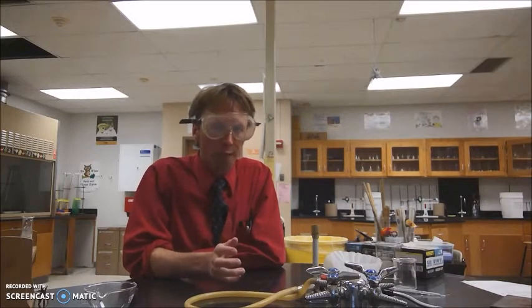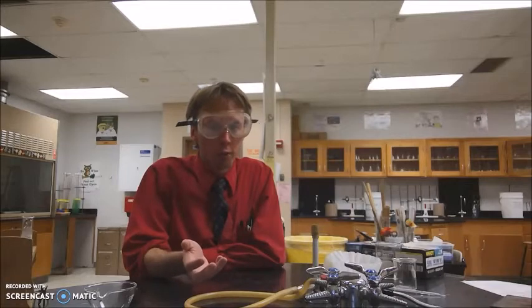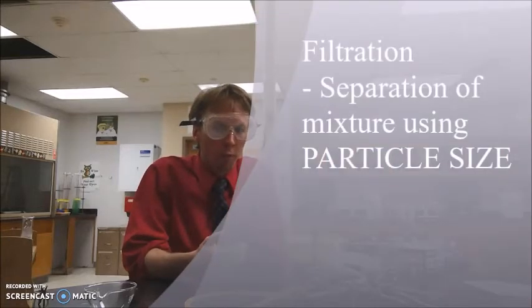For the next part, you're going to do your first of two separation processes. A separation process is anything that takes advantage of different physical properties of the components of the mixture. And the first one we're going to do is called a filtration. If you're a coffee or a tea drinker, you've already taken advantage of this separation process.